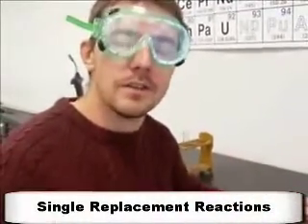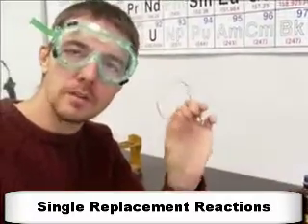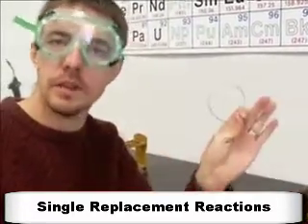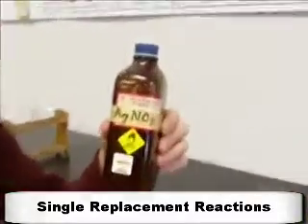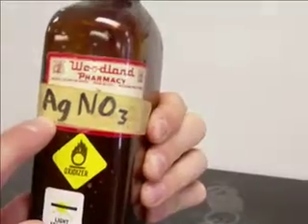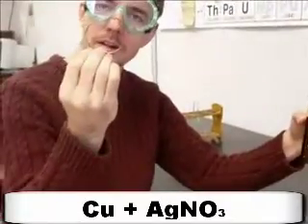Okay, what I want to demonstrate for you now is a single replacement reaction. Now in a single replacement reaction, we start with an element. In this case, we're going to use copper, solid elemental copper, so just plain old Cu, solid. We're going to add that to an ionic compound. This is silver nitrate, AgNO3. So we have a metal ion and we have a metal atom.